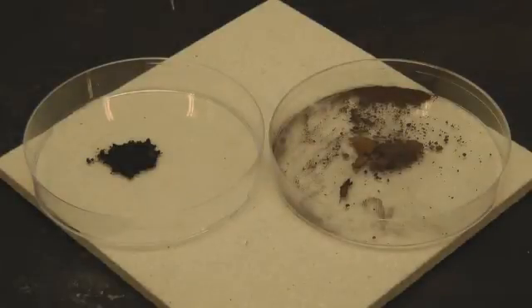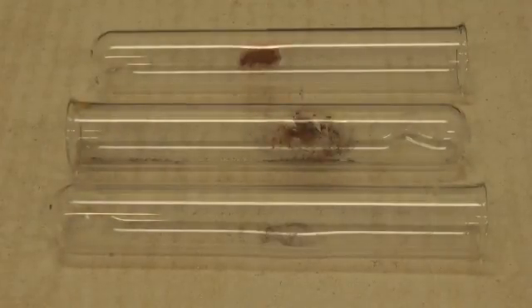Here you can see the copper produced on the right hand side. It is a brown powder. Occasionally you will see copper stained boiling tubes in which this reaction was carried out.